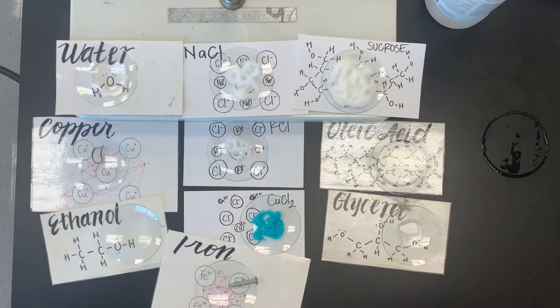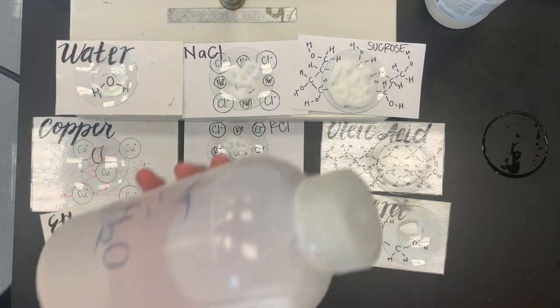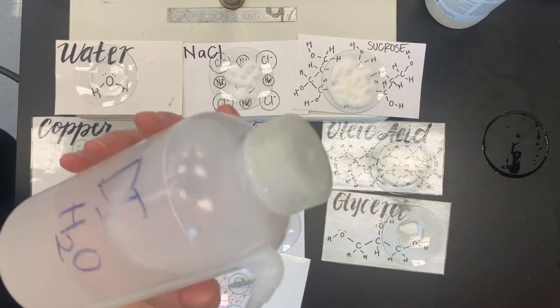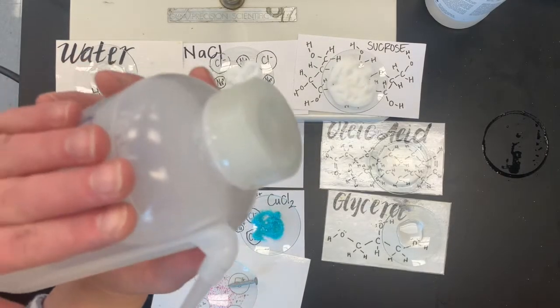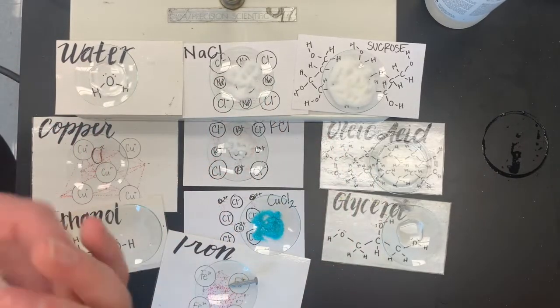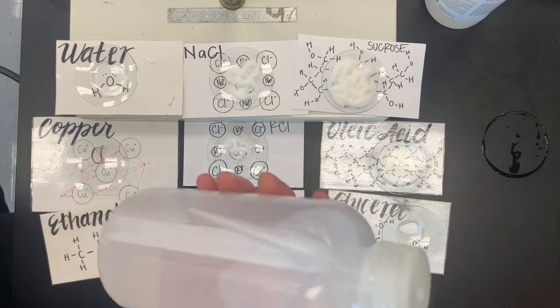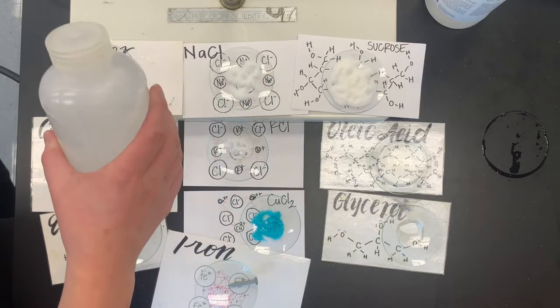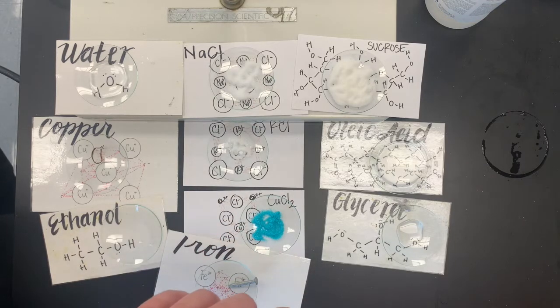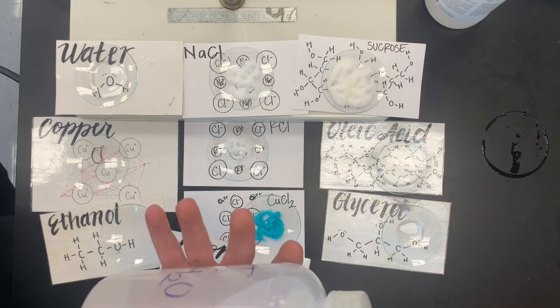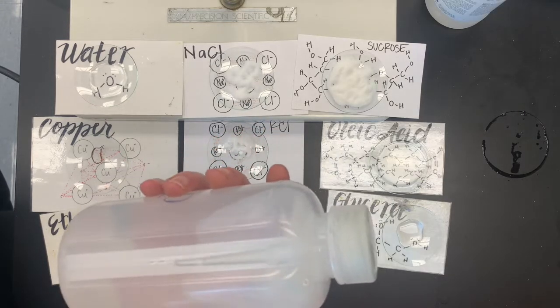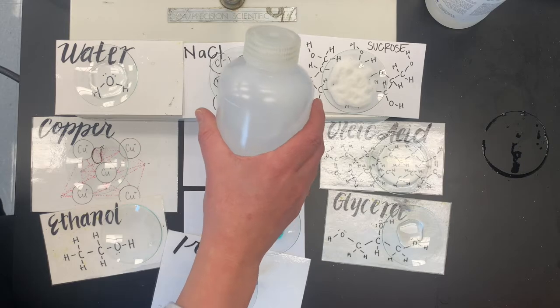The next part of this is whether or not they dissolve in water. So again, like we talked about, I'm using deionized water, so it does not have ions in it. It is just pure, as close to just pure water molecules as we can possibly get. So that's what we're going to be testing. We want to make sure that that's always the same. So water, is water soluble in water? Is it even solubility if you're mixing it with the same thing? I don't know. And what do we mean by soluble? If it dissolves, if it evenly distributes amongst the water molecules instead of just staying in one piece.